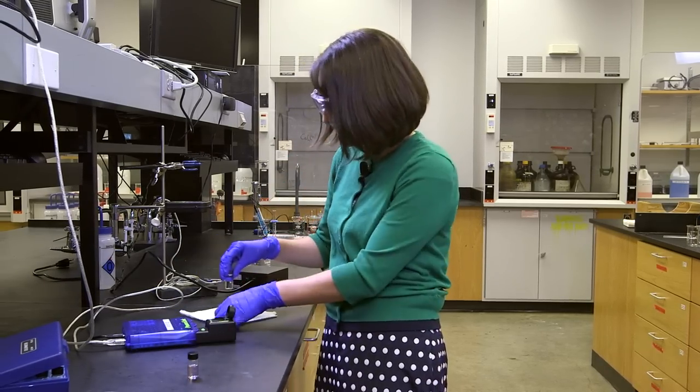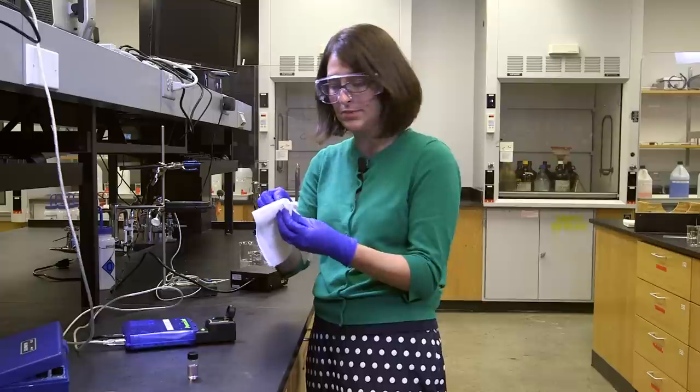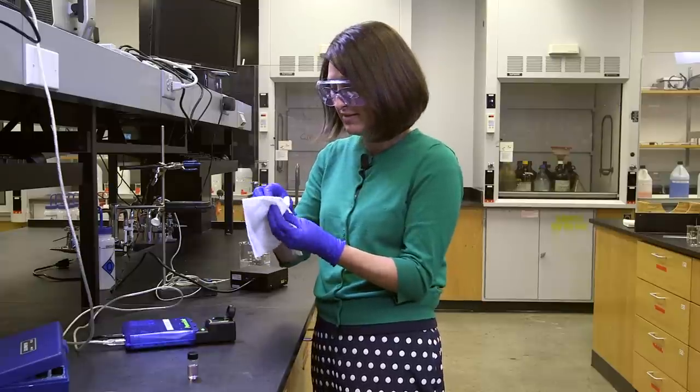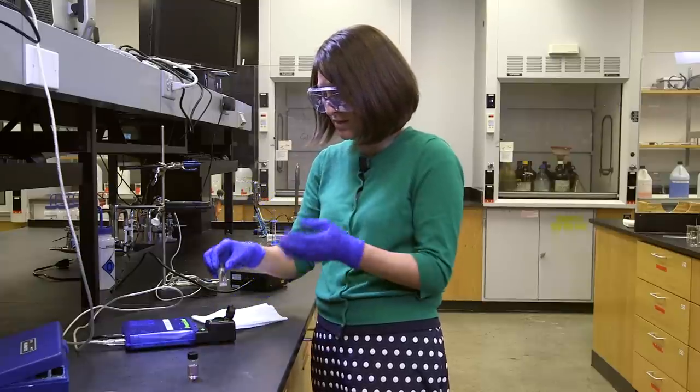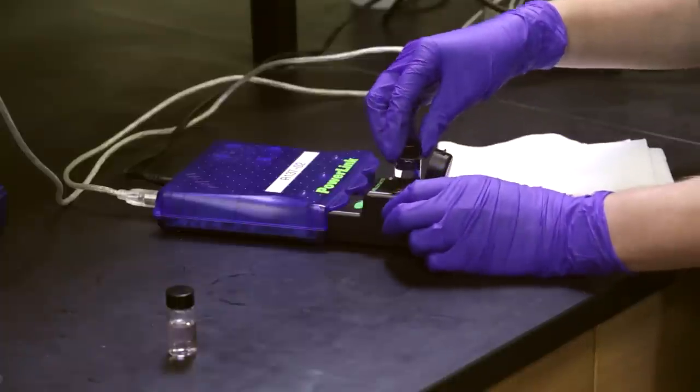It's just a light source passing through a sample. So we have these cuvettes that don't absorb in the region that we are measuring.